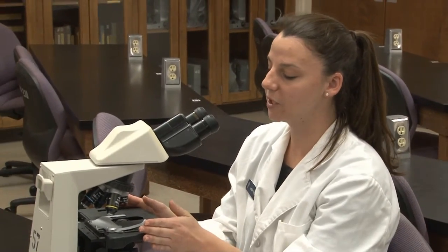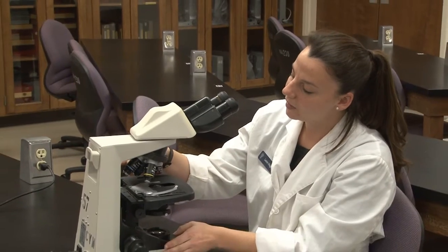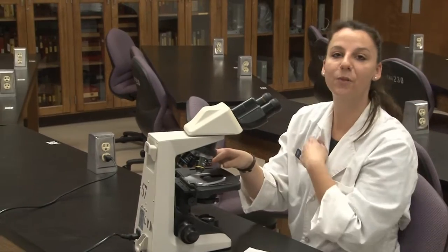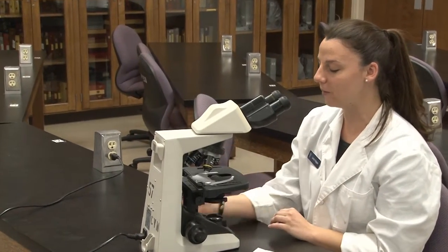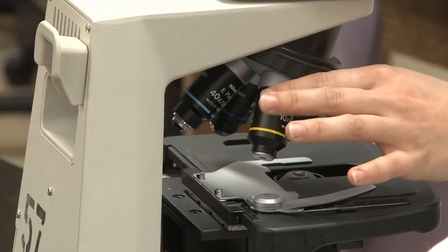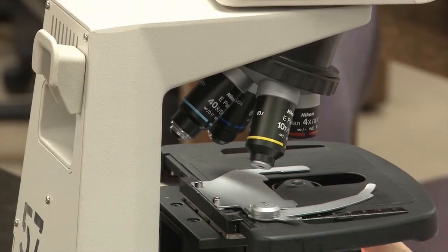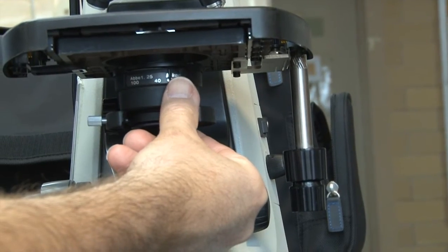First, with my microscope I'm going to make sure that we have the 4x objective in the center and clicked into place. The 4x is the smallest objective and it's usually the lowest power. Once that's clicked into place we can turn on our microscope and we'll adjust the iris diaphragm to make sure that we're getting light through.